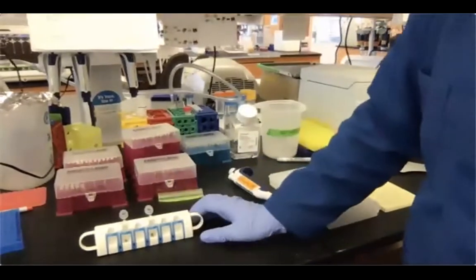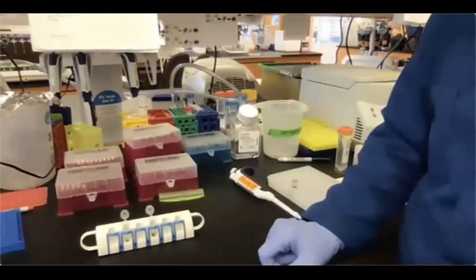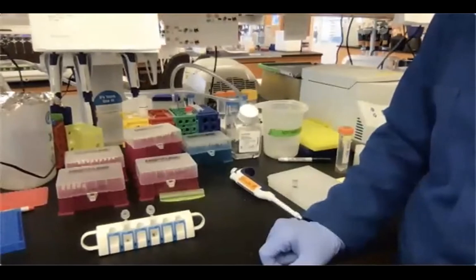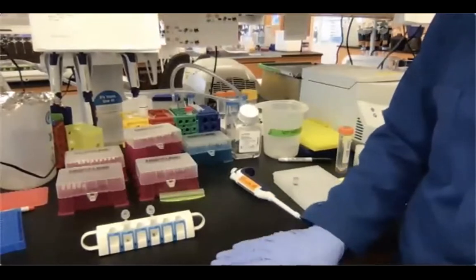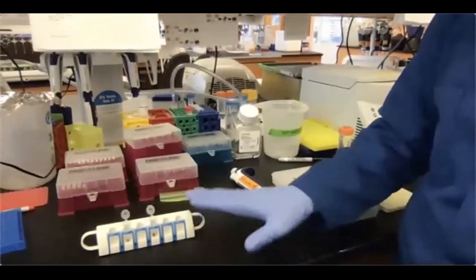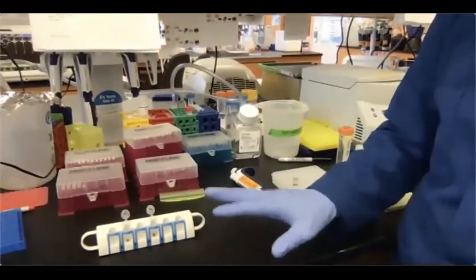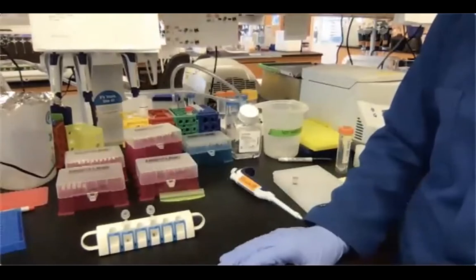We wait about 30 seconds, and then we are good to remove the second ethanol supernatant. As you can see, the volume of the ethanol washes is much bigger than the original supernatant that we left in, about 5 to 10 microliters. So I'm pretty confident that both washes of ethanol removed everything that we had left after the first removal of the supernatant, okay?